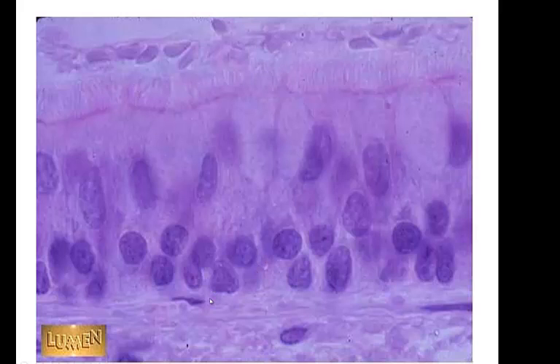So we would find this type of epithelium in our upper respiratory passages, like in our nasal cavity and also in our trachea. And what that does is it helps collect stuff like this, maybe up in our nasal passage, and prevents that stuff from going down into our lungs. So if you want a quick answer for the laboratory practical, what do I put for its function? It is to secrete mucus and trap debris. And where would we find this? In our upper respiratory passages, or you could simply put trachea.